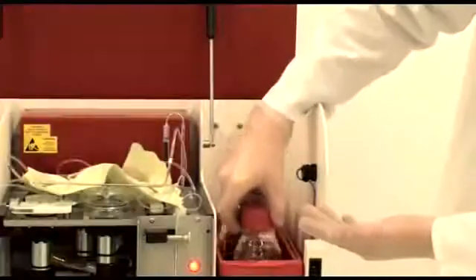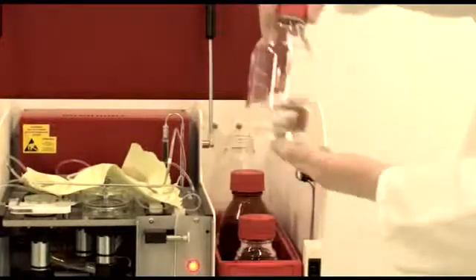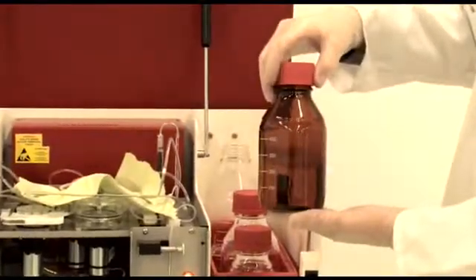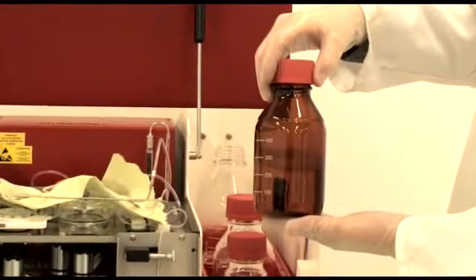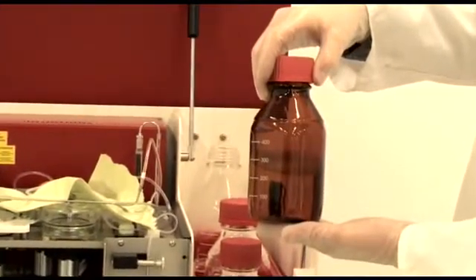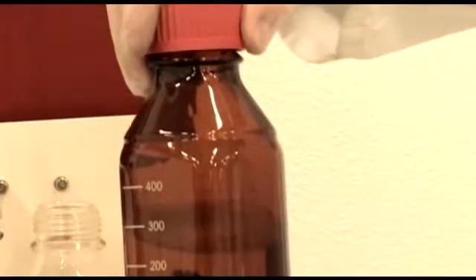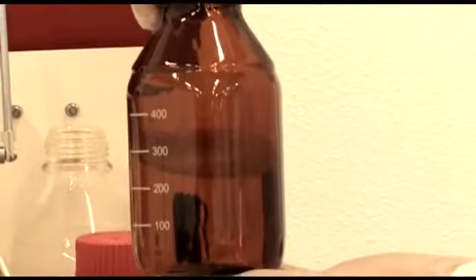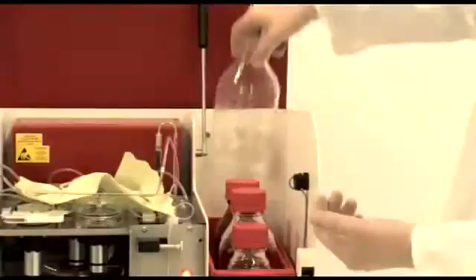Decalm Solution, 5% for cleaning purposes. Number 2 is a Triton Solution for rinsing. Number 3, the DAPI Staining Solution marks the DNA cells in the milk so they can be analyzed by the flow cytometer. A brown bottle is used to protect the staining solution from light. This also differentiates the bottle from others.